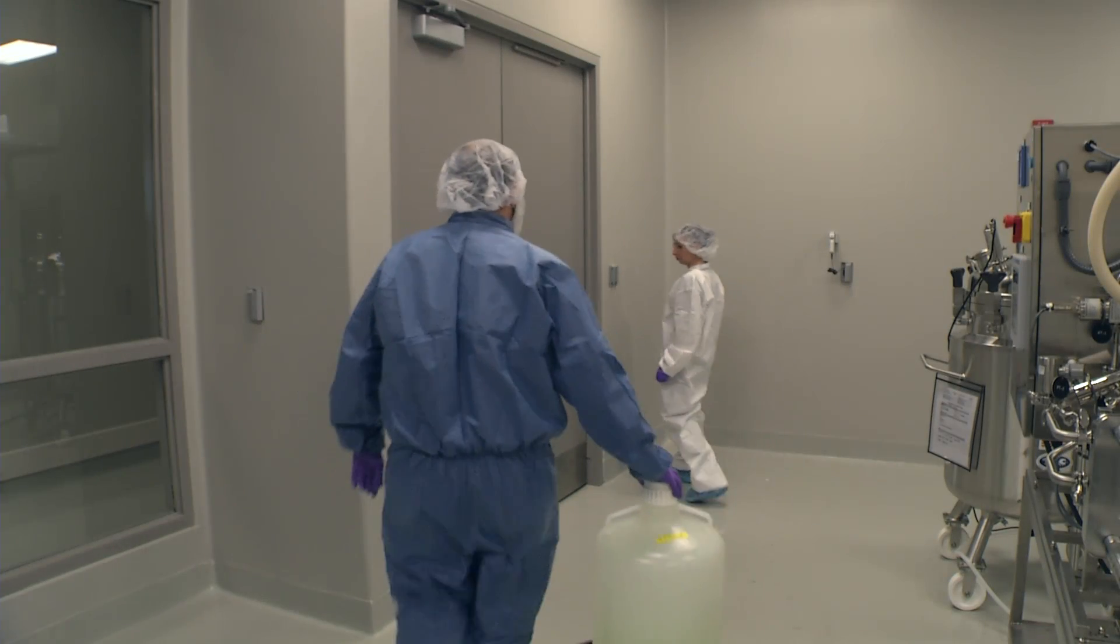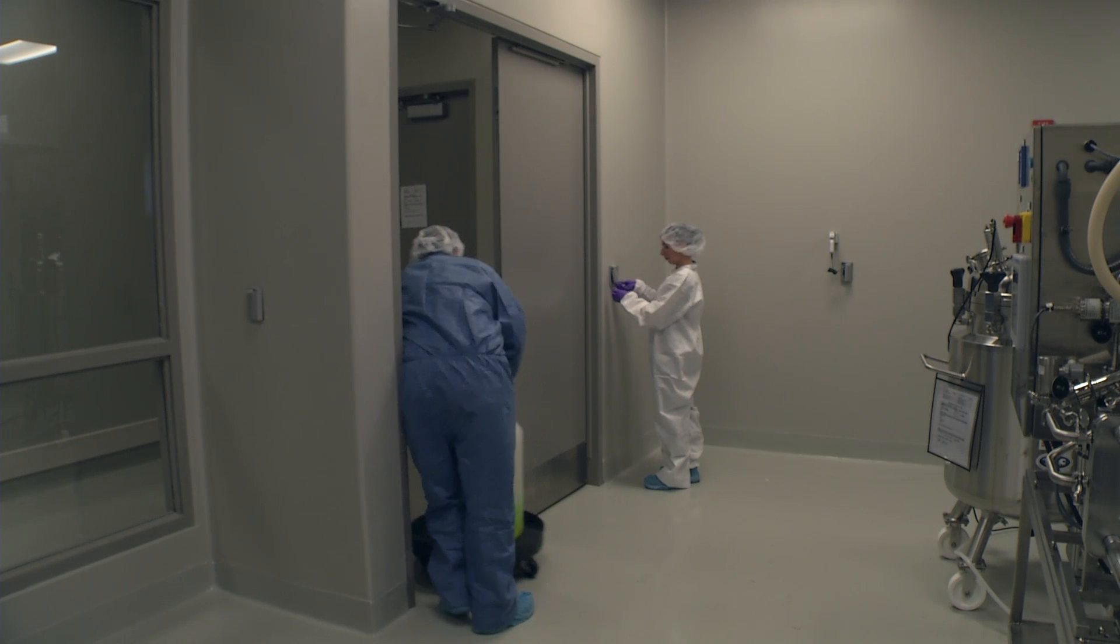The green fluorescent protein concentrate can now move downstream to final fill finish to be freeze-dried and packaged.